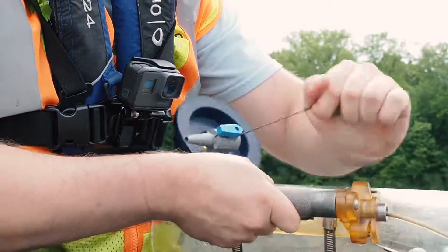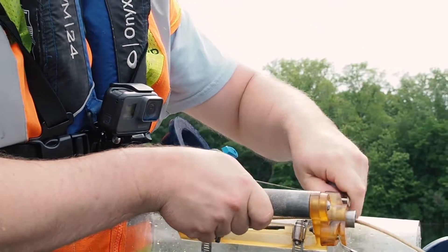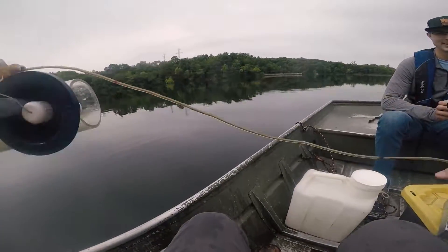We take samples at different depths because nutrients and different chemicals can vary throughout the water column.